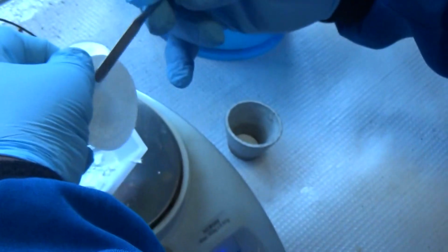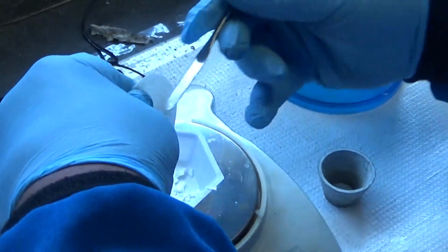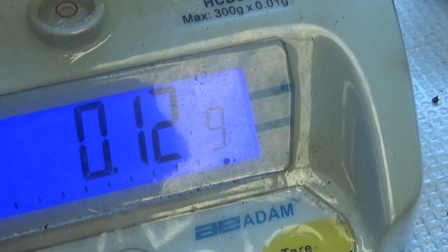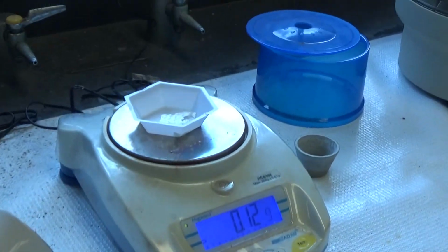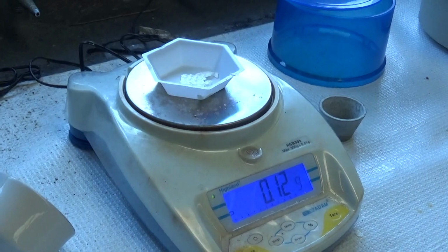So you put your compound, you do like that. Beautiful. And they have 0.12 grams. Okay. 0.12 grams. Yeah. So we did collect 0.12 gram of pure benzoic acid. So the students will calculate the yield or something? Yeah.